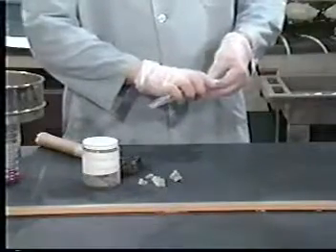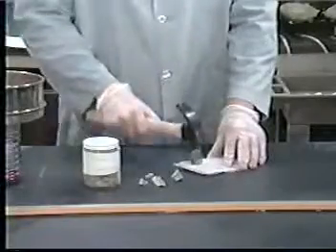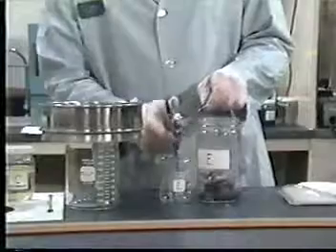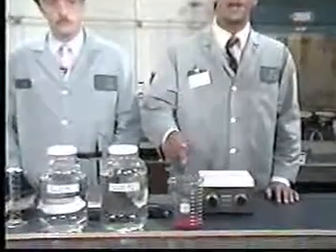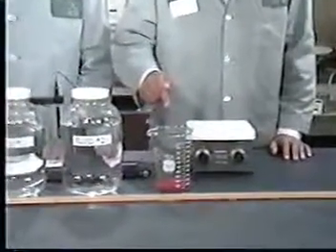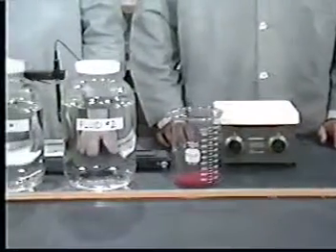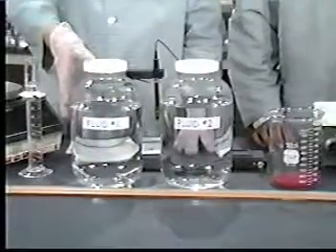If particle size reduction is necessary, it may be done by crushing, grinding, or cutting the solid to increase the surface area. The final determination that needs to be made is which extraction fluid should be used to leach the solid. This step is necessary when the solid content is greater than 0.5% and must therefore undergo extraction, and if non-volatiles are of interest. Note that TCLP extraction for volatiles requires use of only fluid number 1.